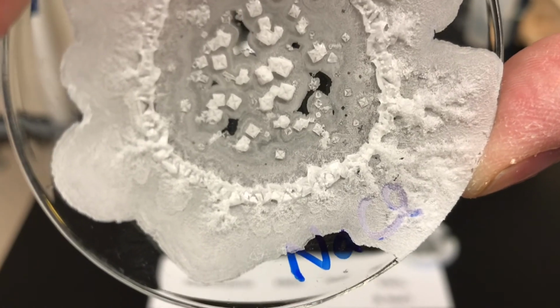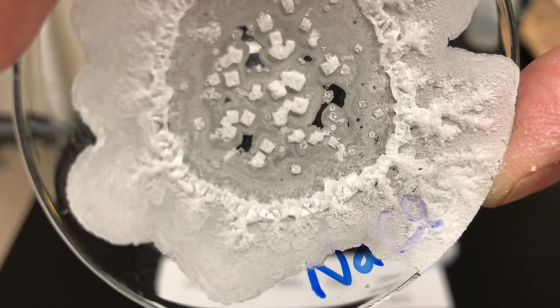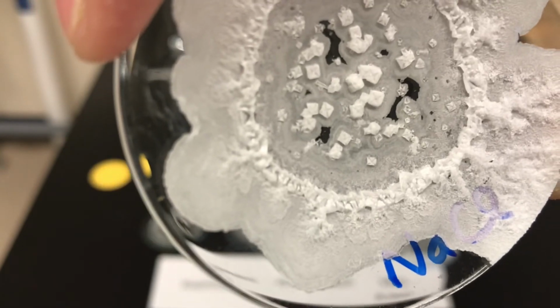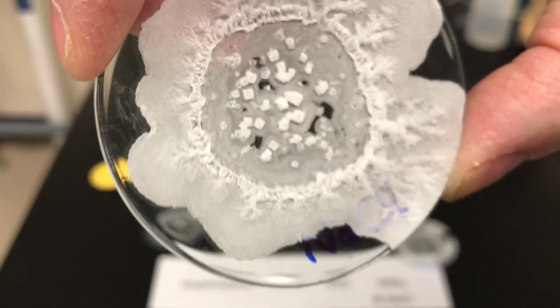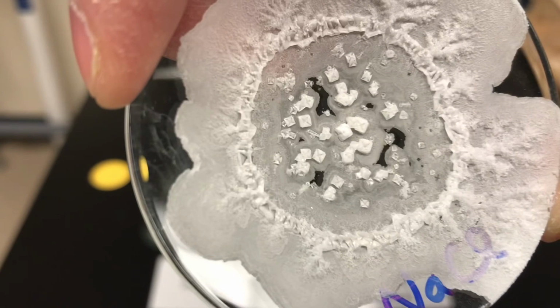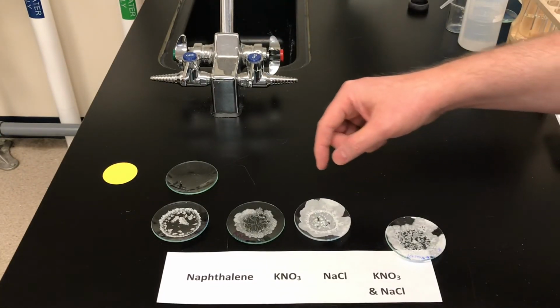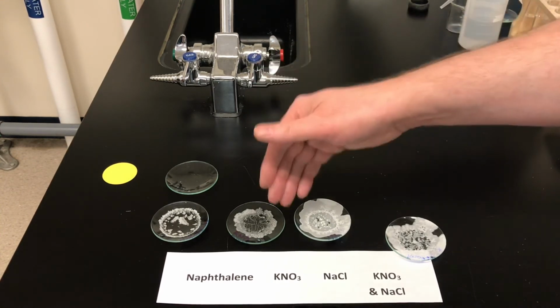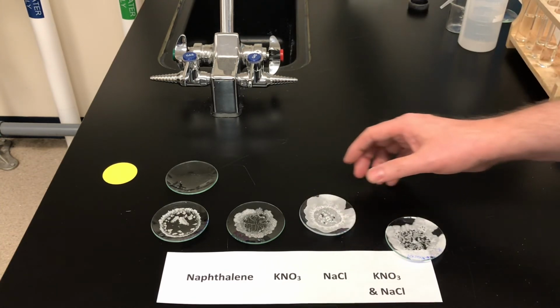And again, where it was maybe more concentrated, you can't see those individual structures around the border of the watch glass. Some students will call these square-shaped, but remember you're looking at the top of a cube. If you imagine just looking at the top of a cube, yes, it's a square, but remember this is three-dimensional, so the proper term is that these are cubic-shaped crystals. So be sure for grade 9 advanced science that you know the type of crystal shape formed by those two salts. Potassium nitrate, needle-shaped crystals, and sodium chloride, cube-shaped crystals.